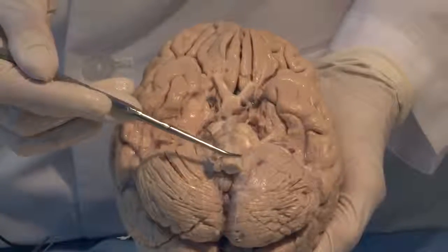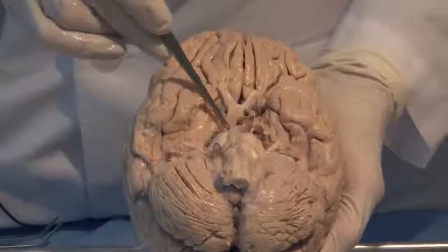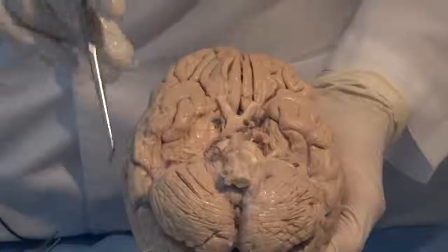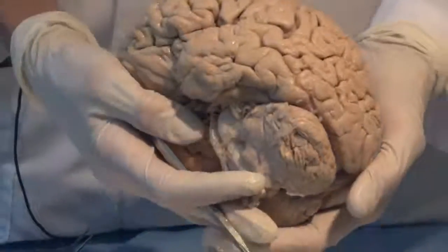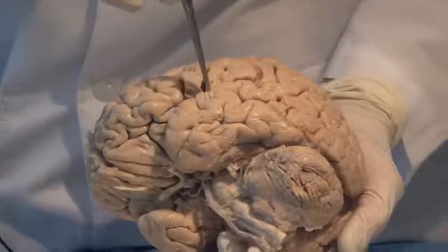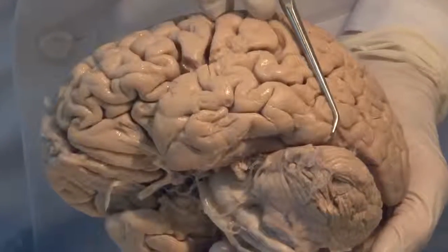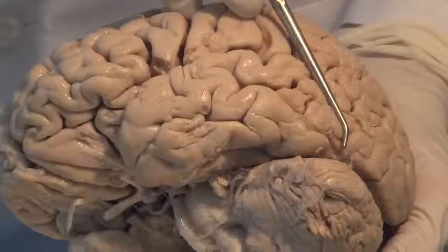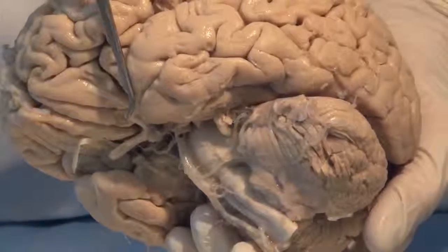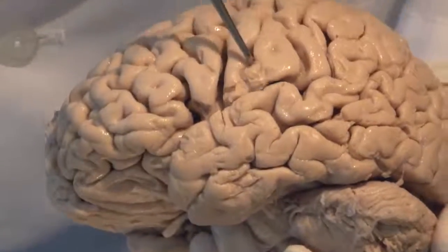But I just want to introduce you to the region of the medulla, the pons, and the midbrain, and together they make up the brain stem. Let's look at the surface now of the brain and look at the different lobes. You already saw the inferior surface of the temporal lobe coming back to here, and we just kind of arbitrarily draw a line and say that this is approximately the end of the temporal lobe posteriorly and the tip of the temporal lobe anteriorly. And then we look for a sulcus on the surface of the brain.